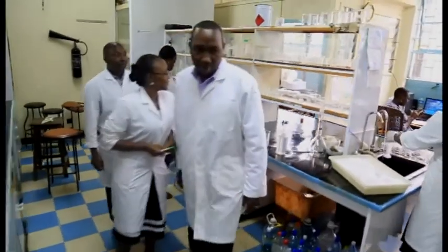We also carry out water treatment chemical analysis. These are chemicals which are used for water treatment. Normally, they are supplied by the water treatment companies or water service providers, who are the common customers.